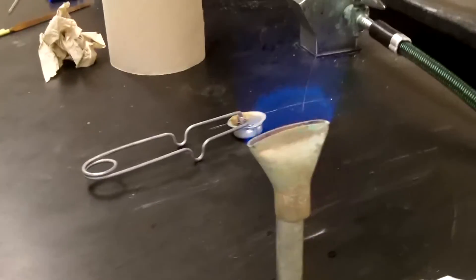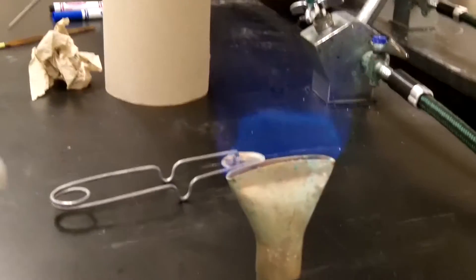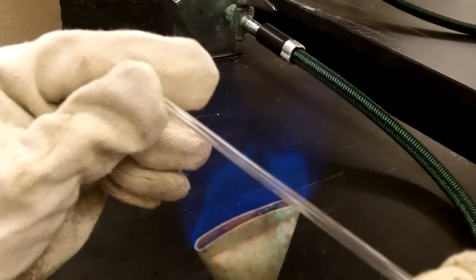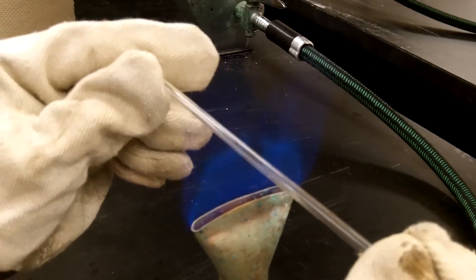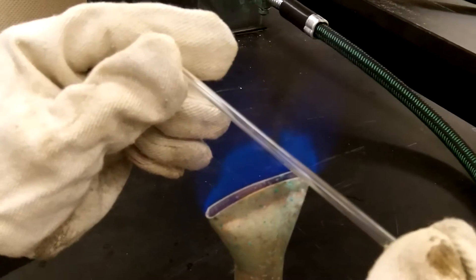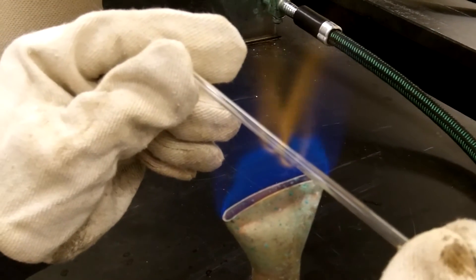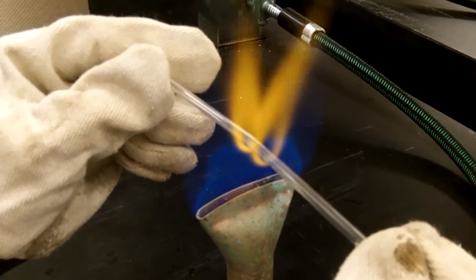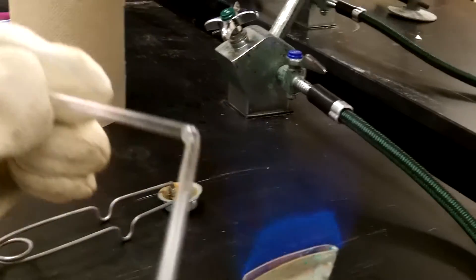Next, pick up your glass tubing and put it in the base of the wing tip. When it is ready, bend it quickly and pull it out of the flame.